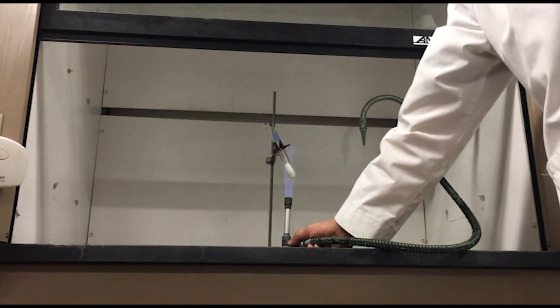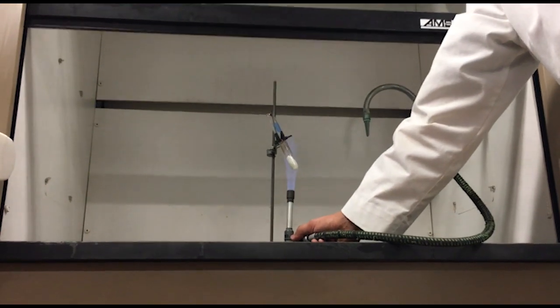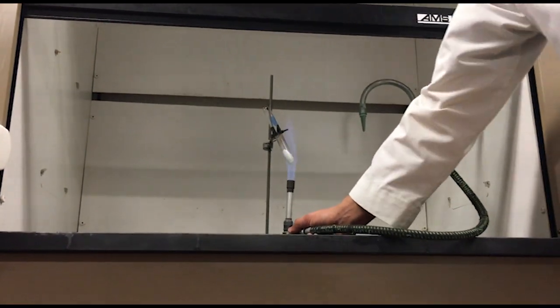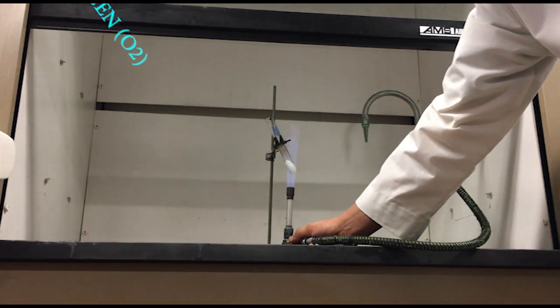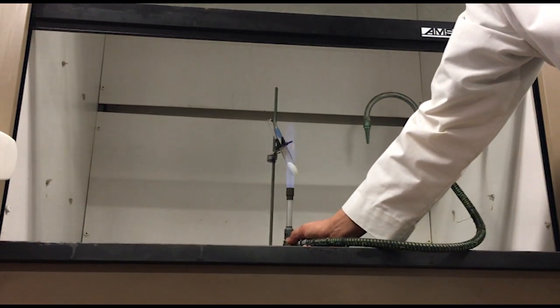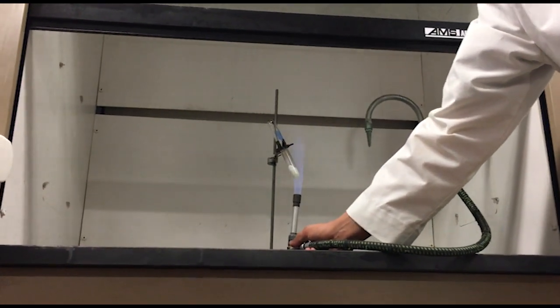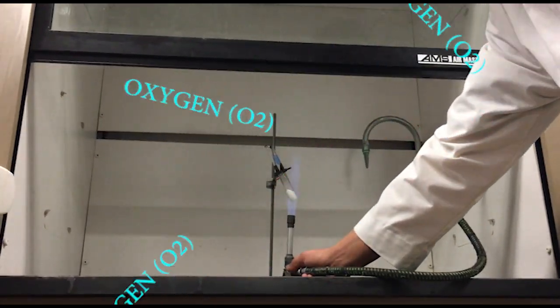Now, what's the other product we said? It's a metallic chloride and oxygen. So what I'm making up here, and you can't see it because it's invisible, of course, is oxygen gas. Now, oxygen gas is pretty flammable, isn't it? Yes. I mean, you breathe oxygen in the air, but our air is only about 21% oxygen. We're going to see what happens in a 100% oxygen environment.